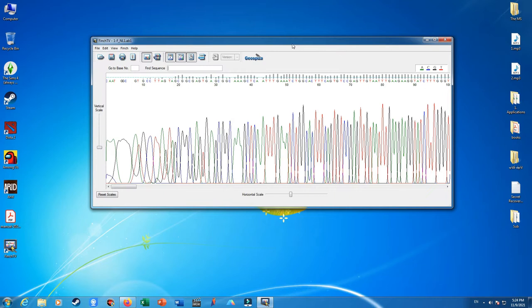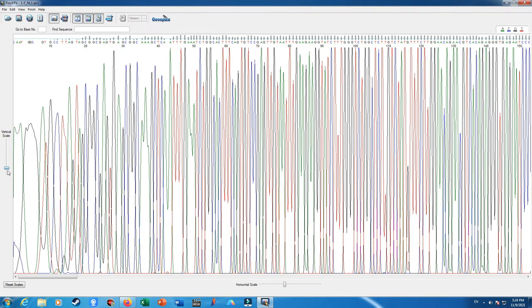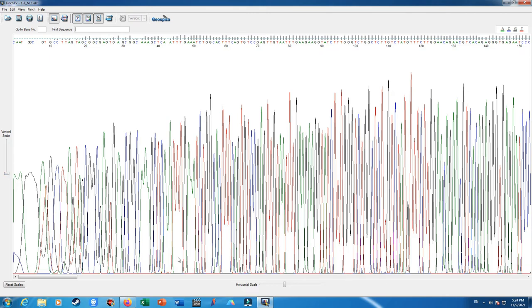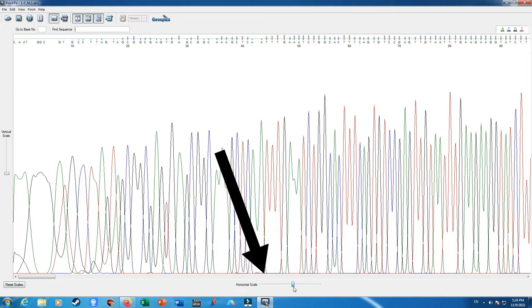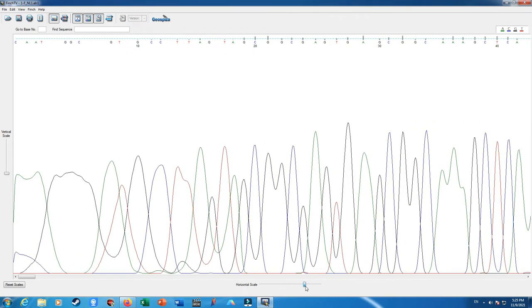As you first open the sequencing results with FinchTV, you will see a pop-up window. It comprises almost all the tools you need to trim and analyze your sequencing. At the left of the viewing side, you are provided with a vertical scale. You can enlarge your view or narrow it down, and there is also a horizontal scale, with which you can see the peaks separately and more precisely.